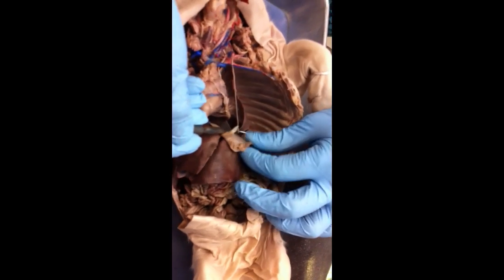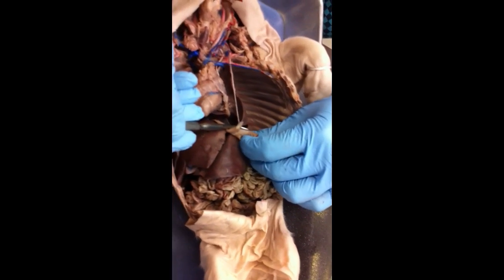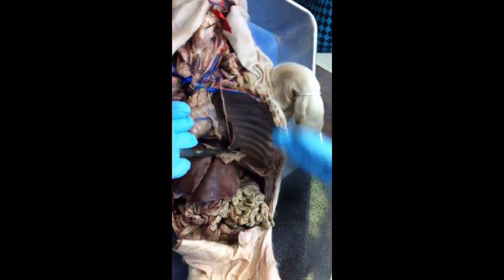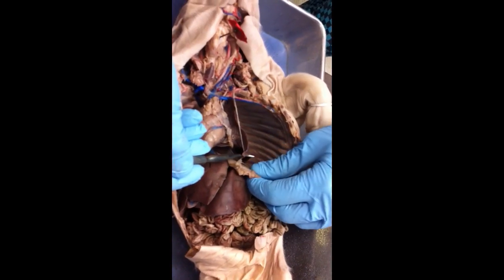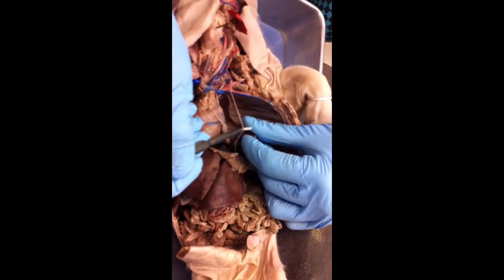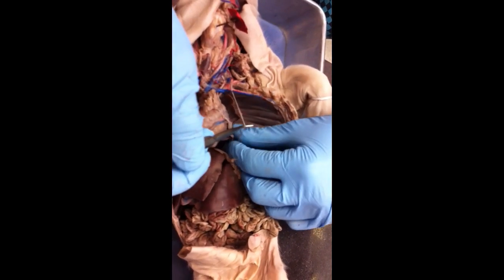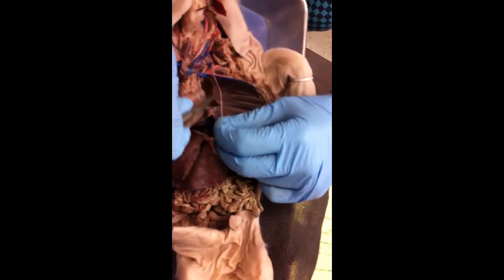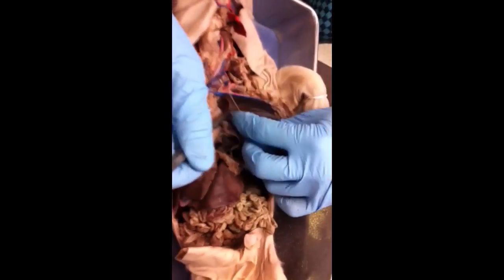It innervates the diaphragm to, you can say, regulate what? What would the diaphragm do if it contracts and relaxes? Respiration. So which system would that be? Well, you can say technically respiratory system, but you can also go with nervous system because it's basically a nerve, yeah.